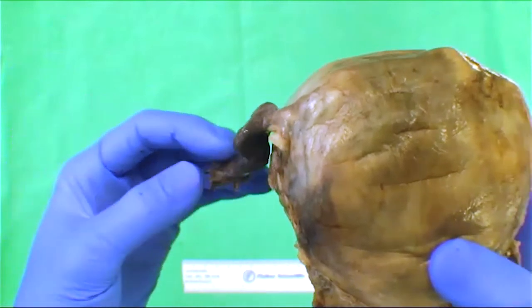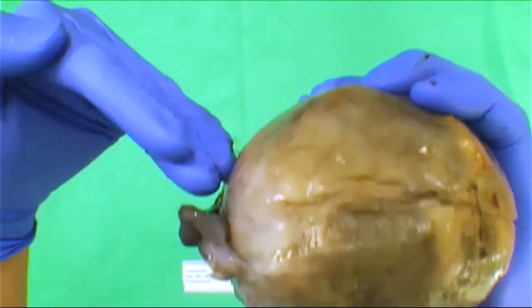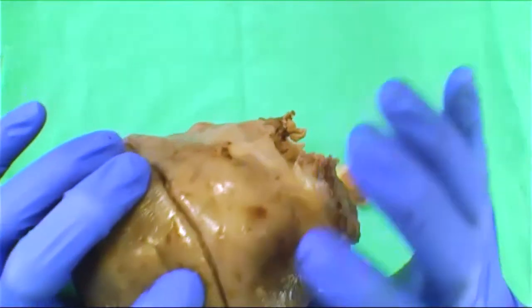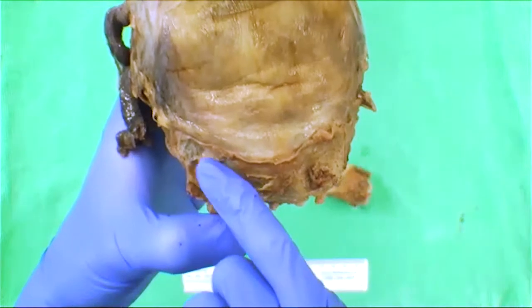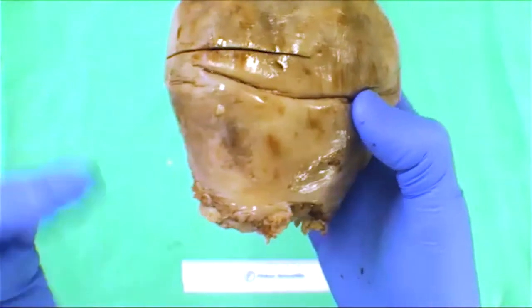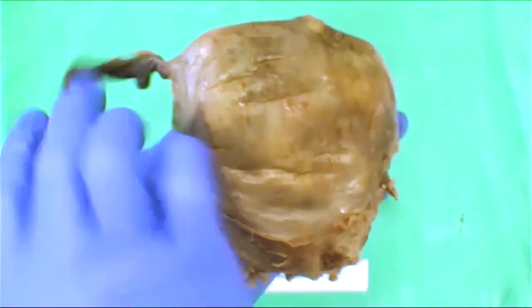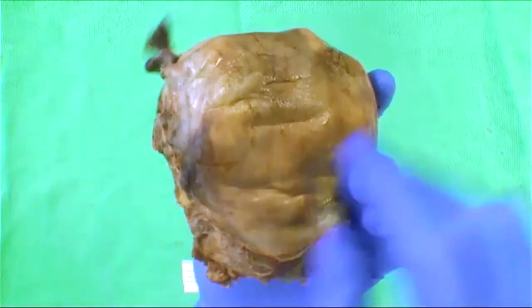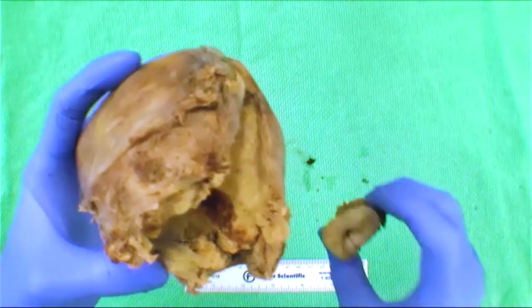There's a fallopian tube here. We've talked before about orienting your uterus using the round ligament anteriorly, the fallopian tube in the middle, and ovaries hanging posteriorly. Here we only have the fallopian tube, so we look at the peritoneal reflection — it's present here and a bit higher on this aspect than the other side. Using that, we can localize anterior versus posterior, identifying this as a right fallopian tube submitted in this case.